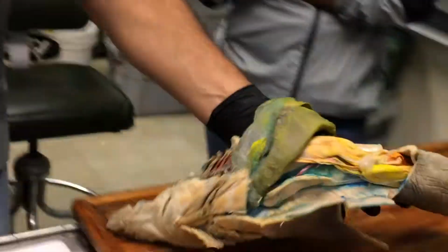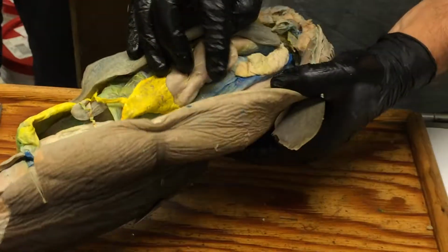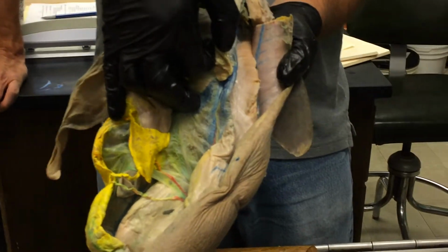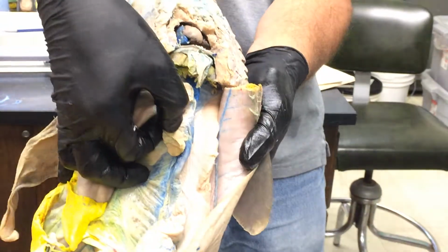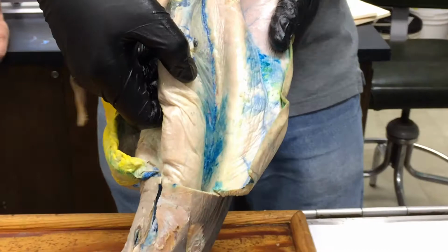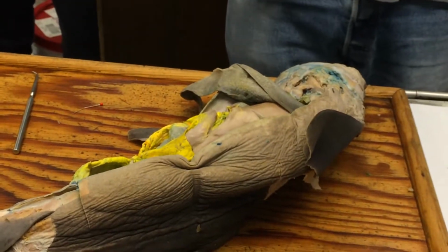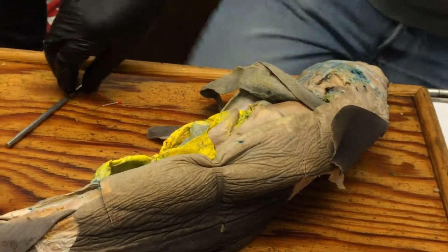Okay, so that's the mesorchium, and there's likewise in a female a mesentery of the ovary, which is called the mesovarium. Not too unreasonably, right there. Okay, you see that? And then the oviduct itself has a mesentery, and that is called the mesotubarium. It's going to the tube, the ovary, the oviduct, right there. All right, so those would be mesenteries. See, this is nice stuff, yeah? Very simple, makes sense.